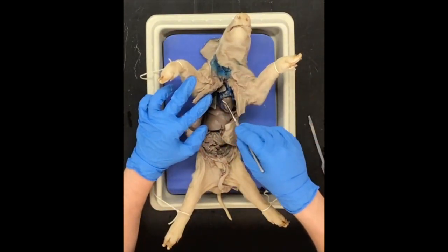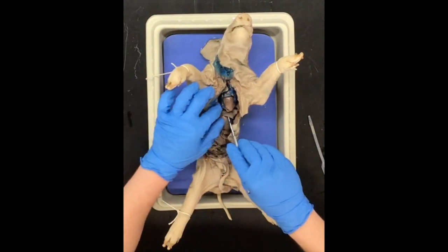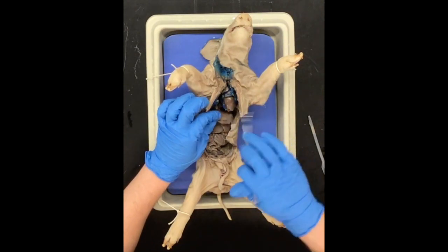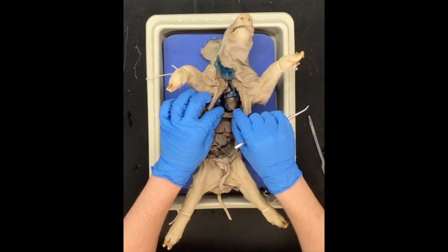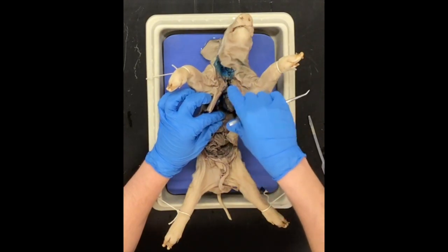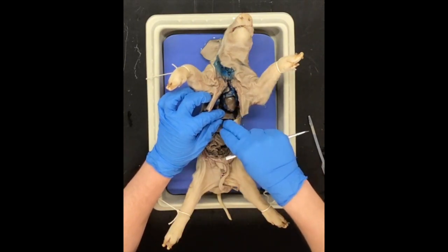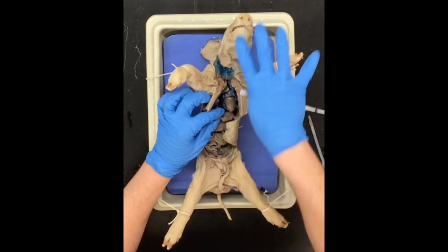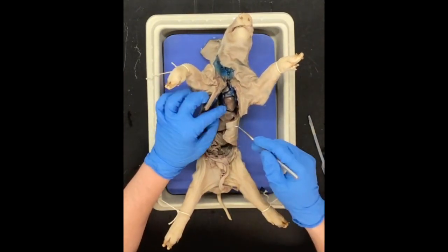The lungs and the heart are in our chest cavity — or in this case, the pig's chest cavity. Right underneath them is the diaphragm. The diaphragm is the muscle that separates the two cavities. Basically, the diaphragm changes the pressure by contracting and pulling down, causing negative pressure in the chest and allowing the organism to breathe in. Then as it relaxes, it rises up, creating positive pressure in the chest, causing the organism to breathe out. So air can enter and exit the lungs as needed using the diaphragm muscle.